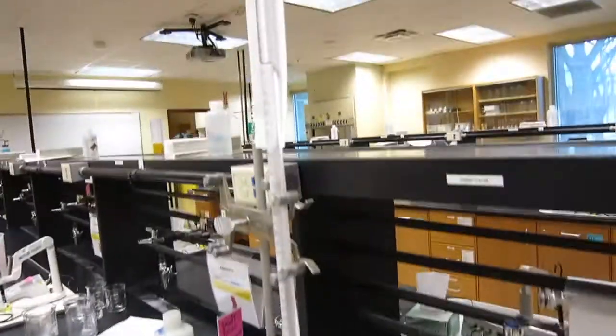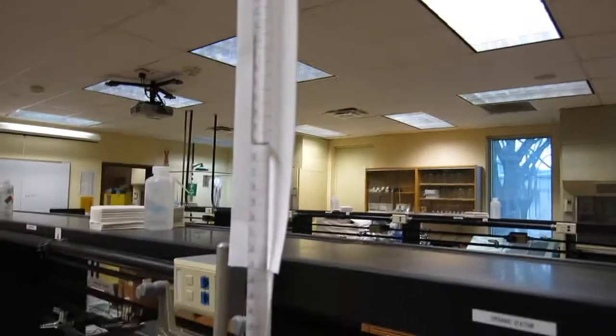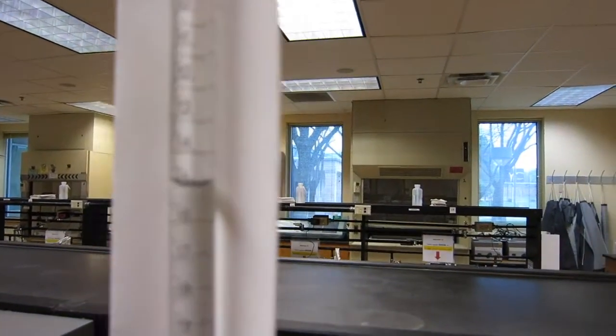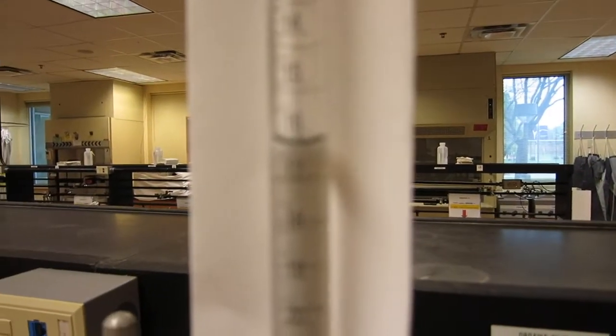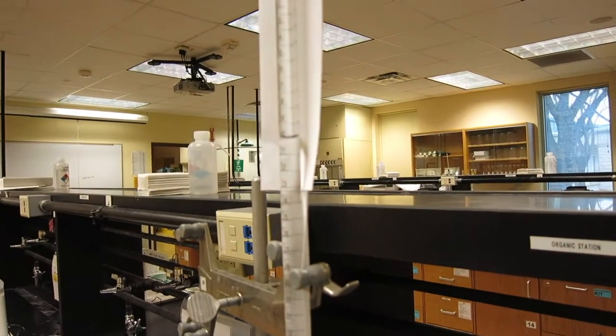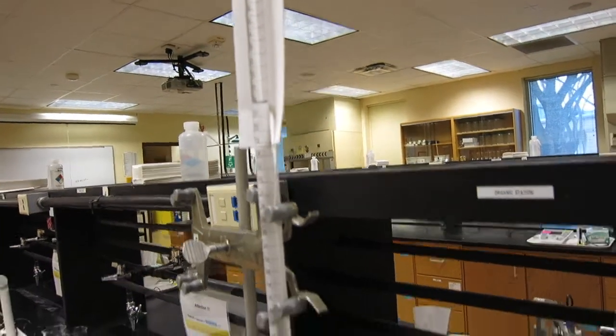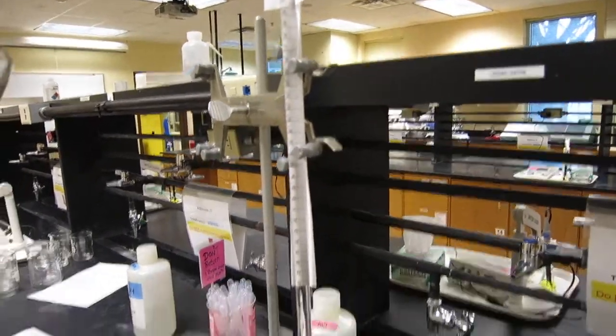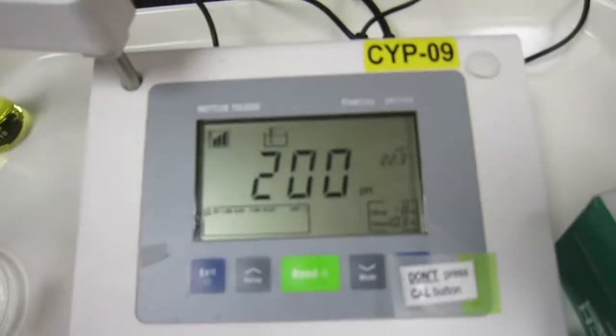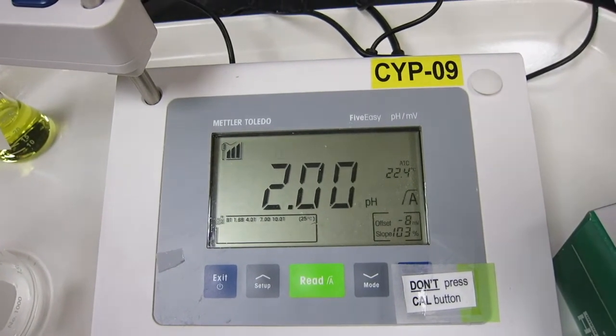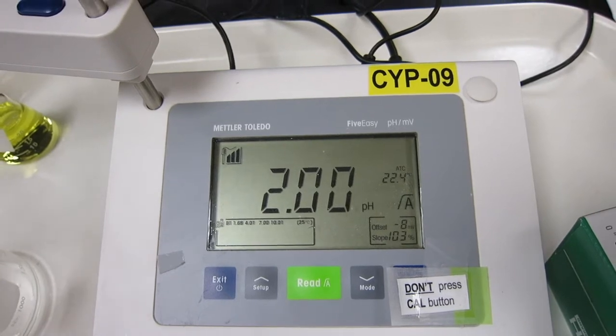What's next? Another 5 mL, up to 20. Dispense another 5 mL. Now there's 20 mL NaOH in the beaker plus the 25 mL HCl. You ready? Now I'm going to read again. Swirl. It's raised up to 2.00.